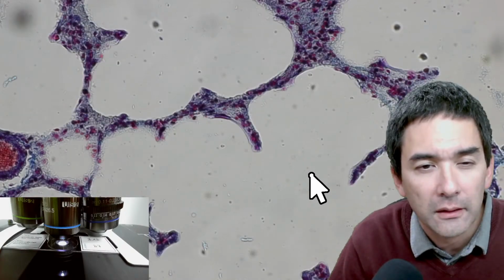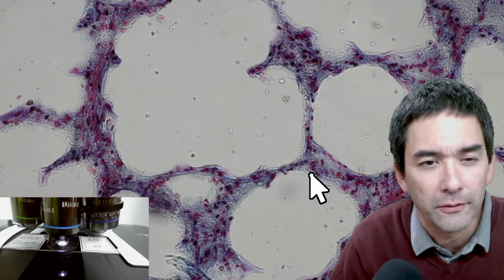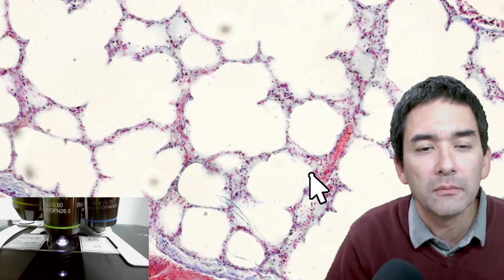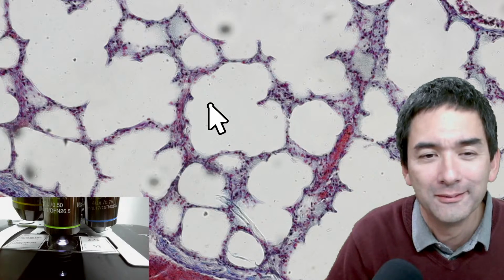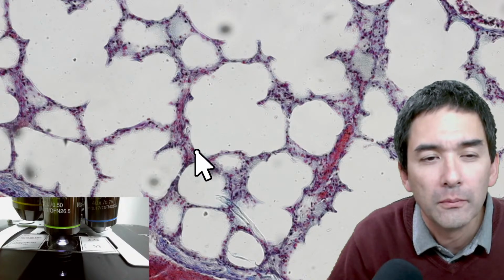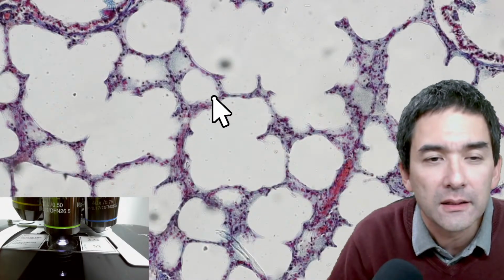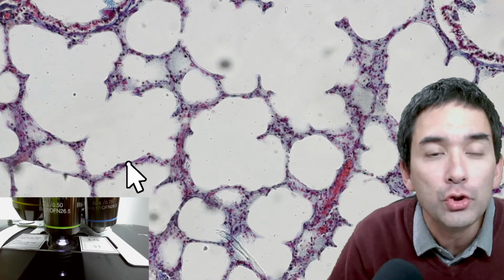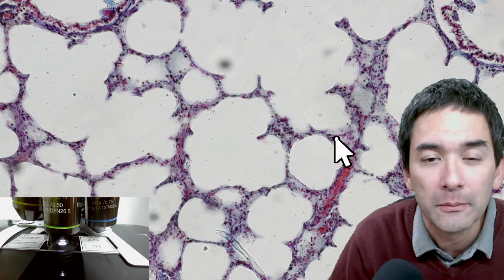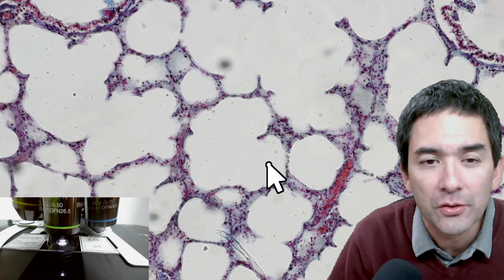When you look at the lung of a cat, it looks pretty much the same also for humans. You're going to see there's a lot of white stuff here. Let me go down with the magnification. You see that there's a lot of lumen, the white stuff, and then there are some fairly thin walls of cells. This already illustrates that the lung is very spongy in nature. However, it is not completely hollow. There is a lot of blood in the lung because of the blood vessels over here. But in here, these are the so-called alveoli, the air sacs.